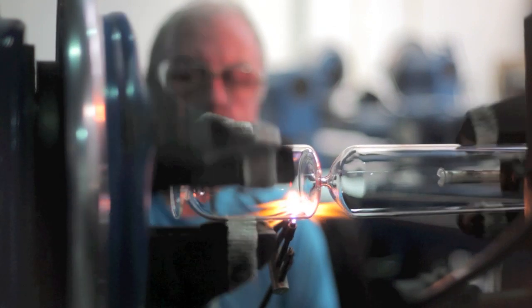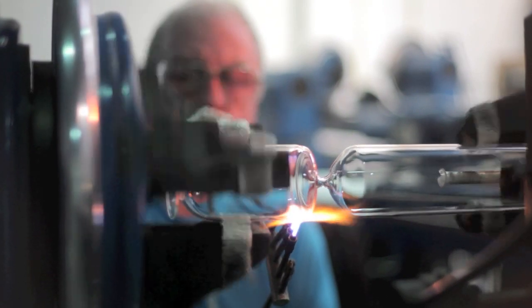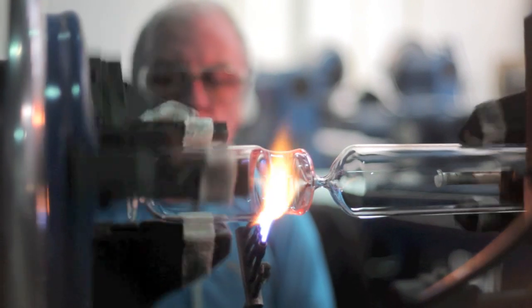Now I am going to go onto the small burner. A really fine flame now. Put it right on that mark that I have put on there with the chinagraph. And then I am going to divide it. Start stretching it and heating it and blowing it at the same time. There we go. Some of the blow and that will come off.